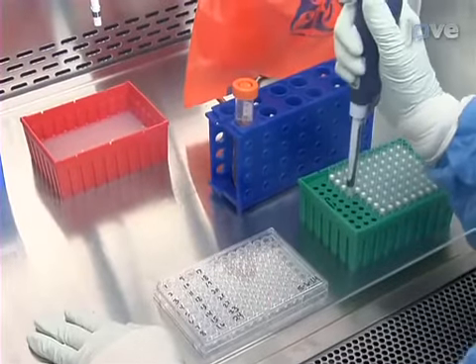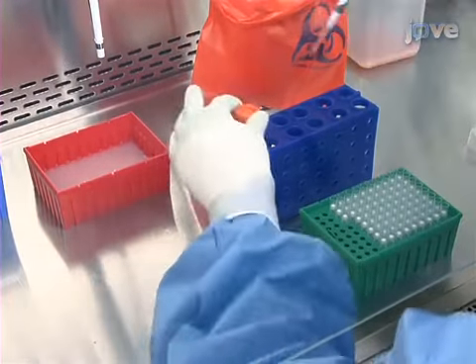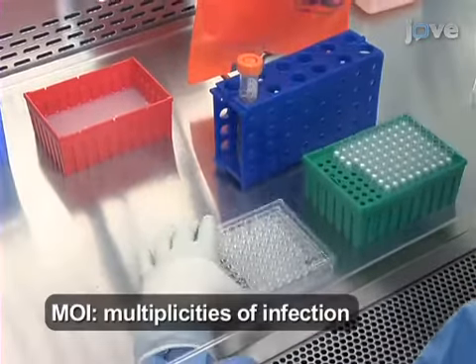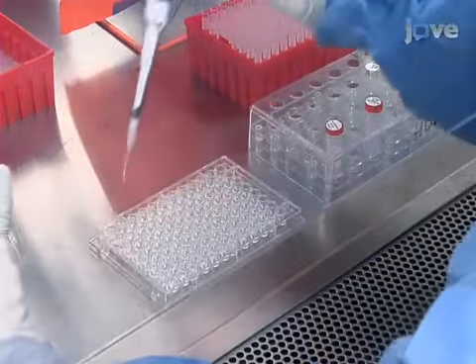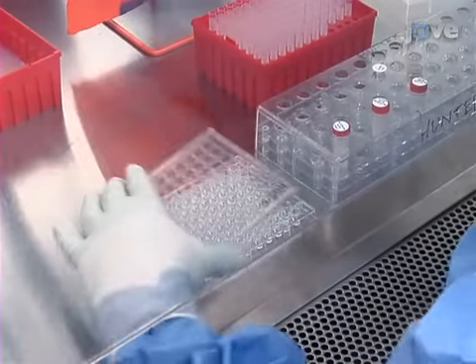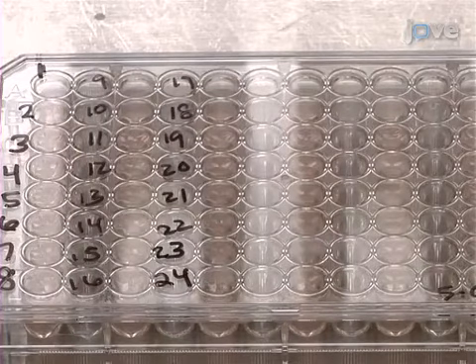Next, dilute the virus in CRPMI media to a volume of 100 microliters in order to achieve a 0.05 MOI. Add it to the V-bottom tissue culture treated 96-well plate, including both a positive and a negative control in each set of replication experiments, and set up the plate such that every other column is blank to limit cross-contamination between wells.